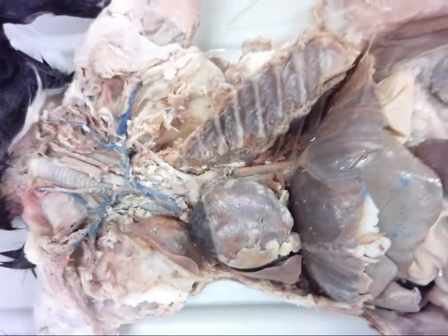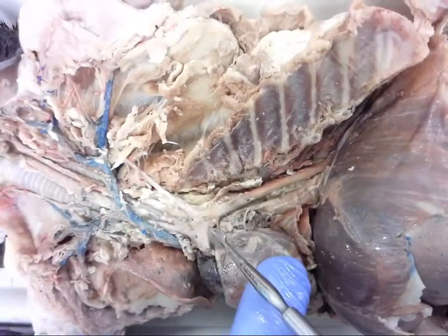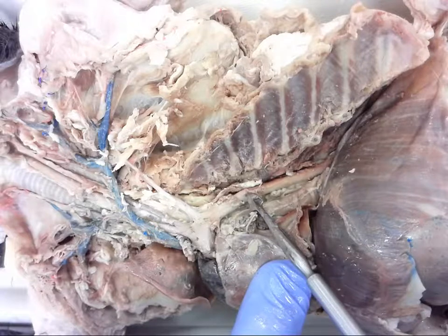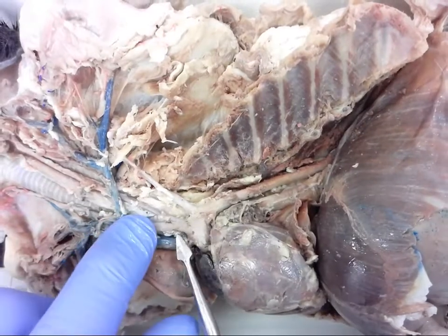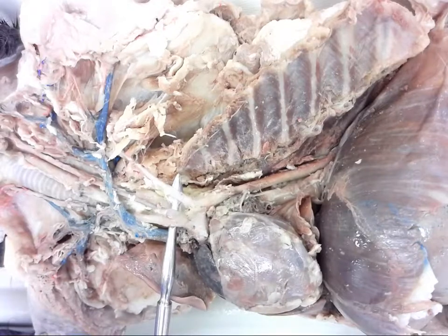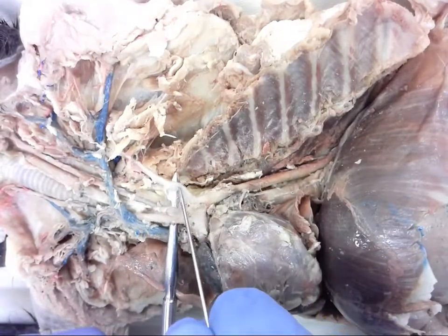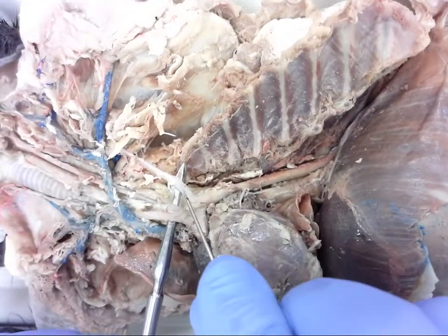Number ten — we should probably try and get from a different angle. Number ten is here, runs all the way down through. I'll lift this up and use the pin to identify number eleven, right here. The lighting's not great but you can see branches off of number ten to find number eleven.